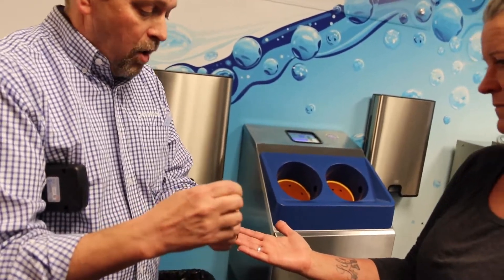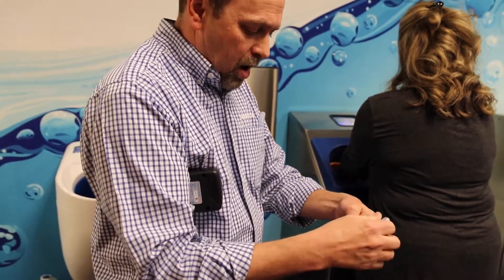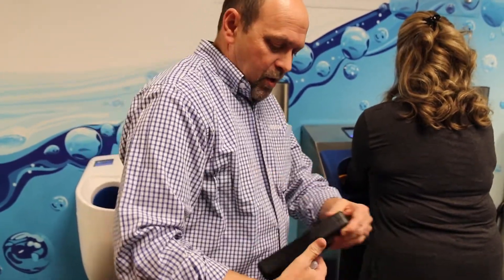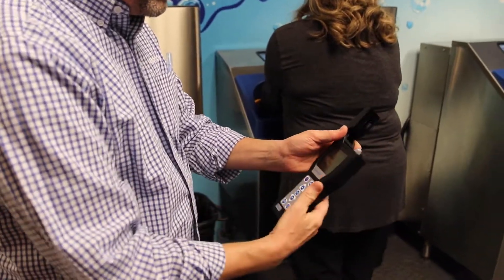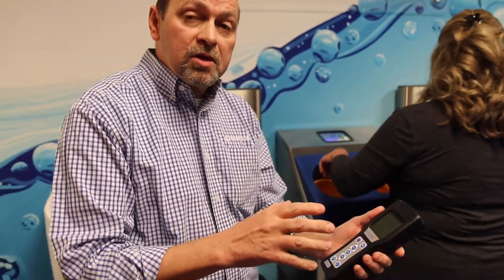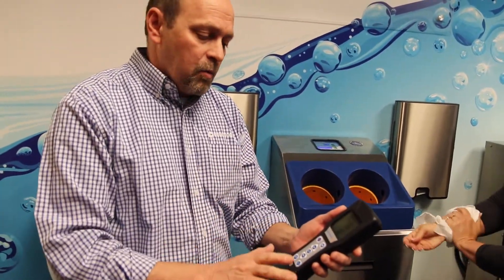Go ahead and wash your hands in the Cleantech 500EZ. I'm going to activate this ATP swab, put it in here, and shake it like a Polaroid a few times, then put it in the Hygiena Sure Plus system. The reason we use the Hygiena system — Meritech has a white paper on it and Hygiena has put a white paper on it as well. Not all ATP testers are identical. Other testers we've found actually detect skin, which also contains adenosine, giving varied results. With the Hygiena we've gotten really consistent results.